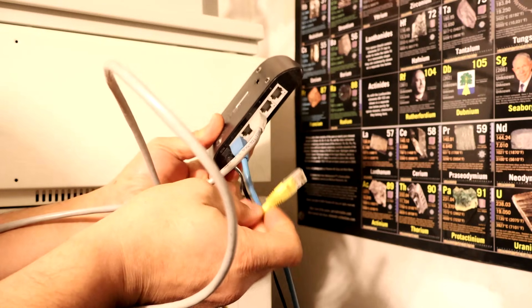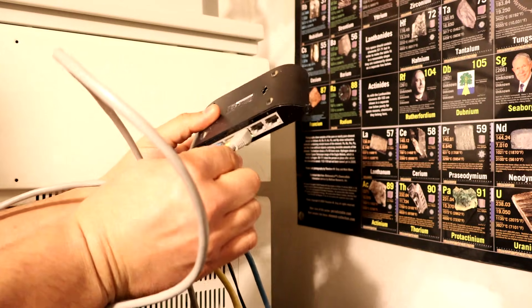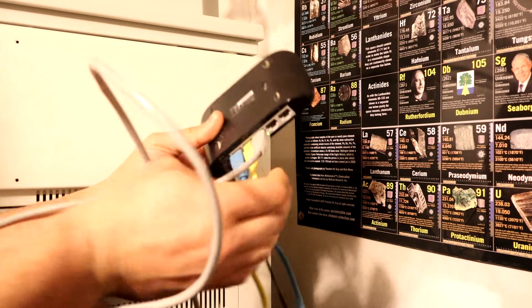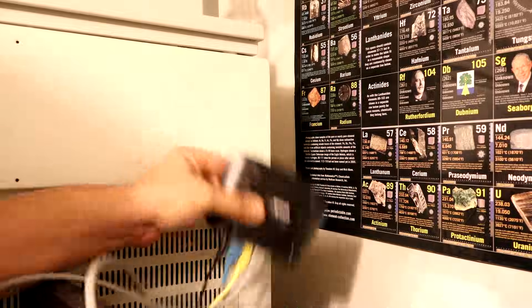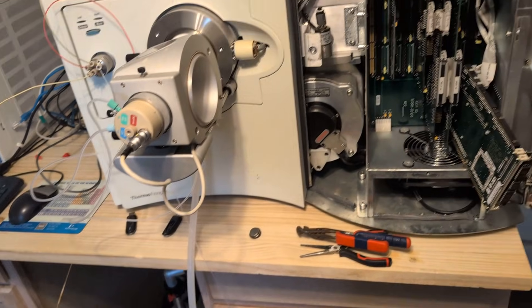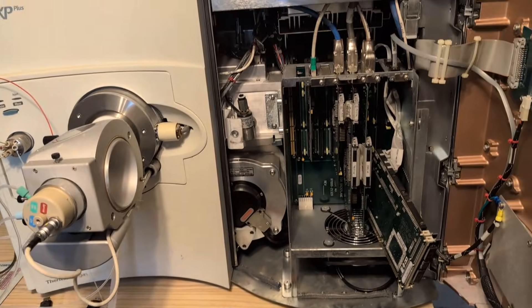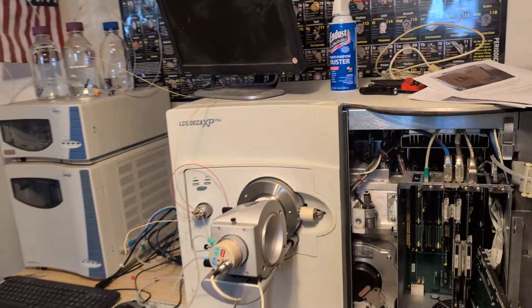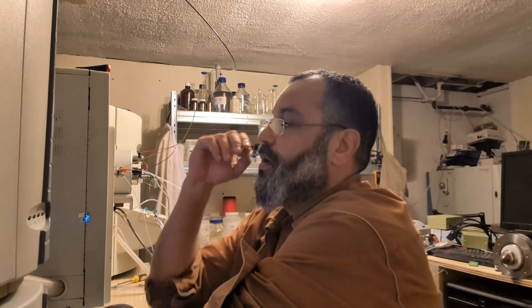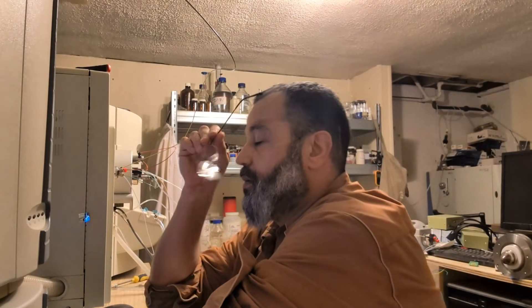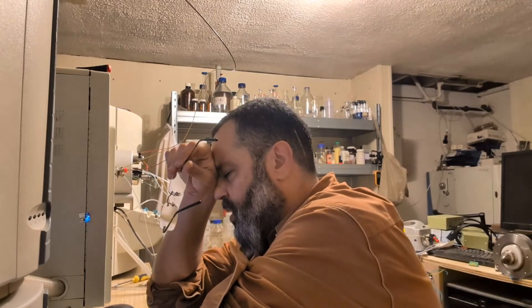The autosampler photodiode array communicates with the computer using ethernet connections on a dedicated network card. The pump however uses a regular RS-232 and the mass spectrometer has its own separate card on a different network. The MS has its own onboard computer and getting this 22-year-old to wake up took some spare parts and a lot of patience.